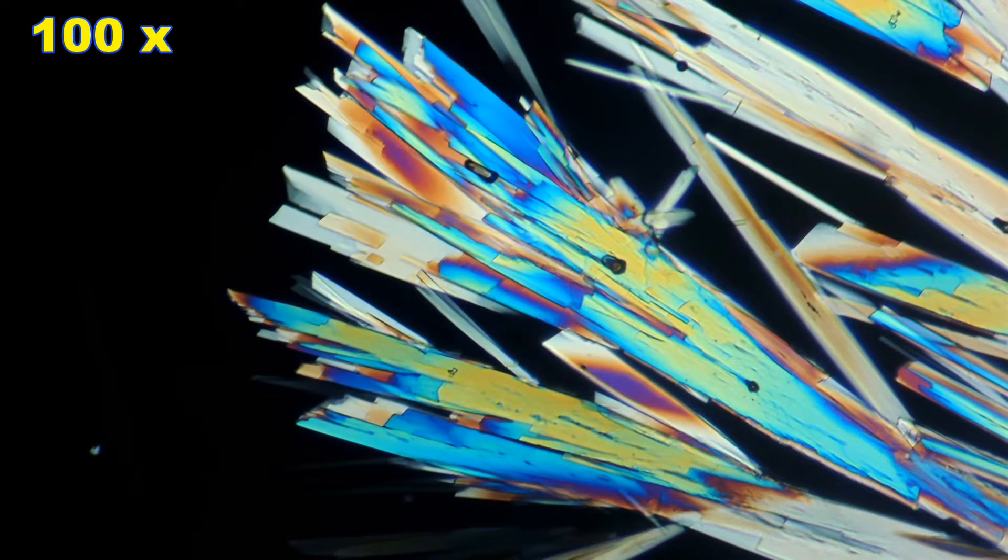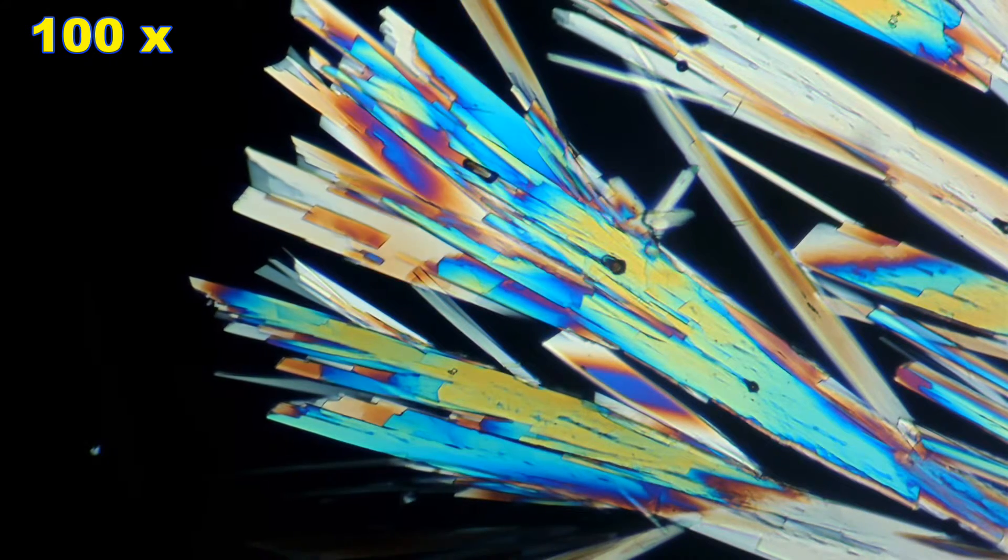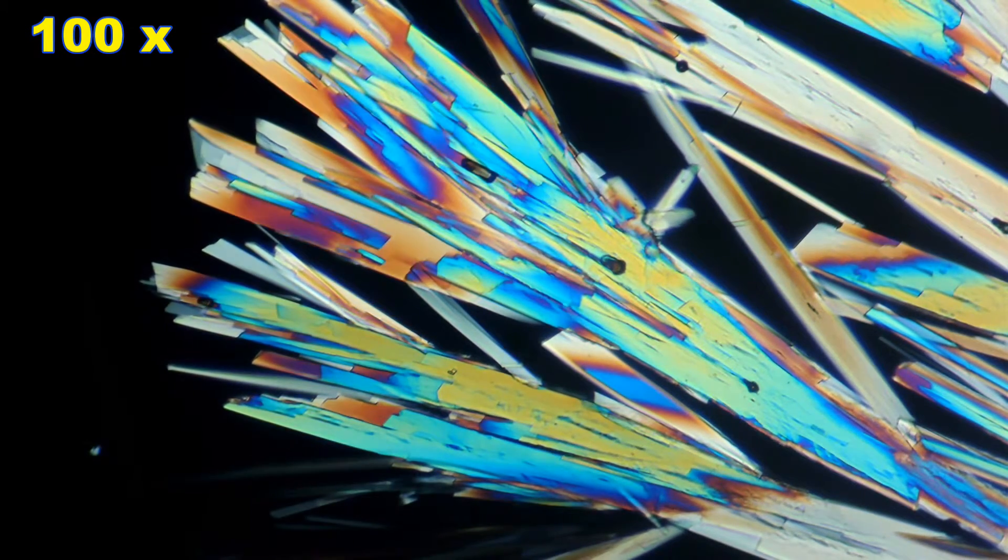This actually covers 27 hours of crystallization time in this video.